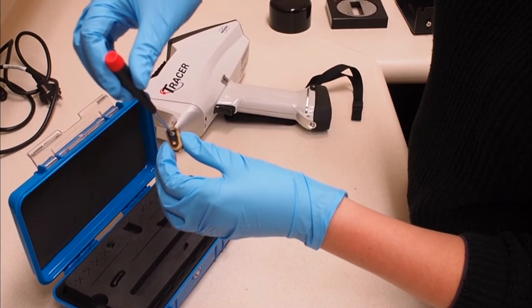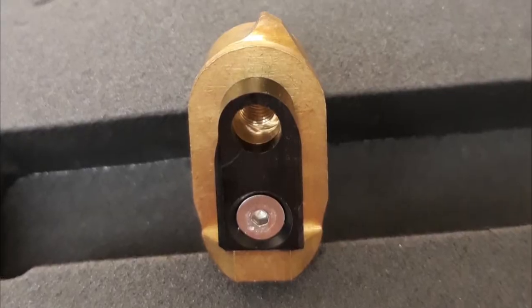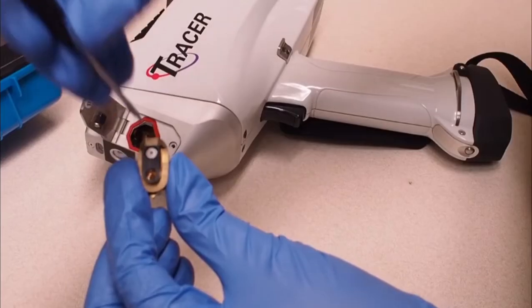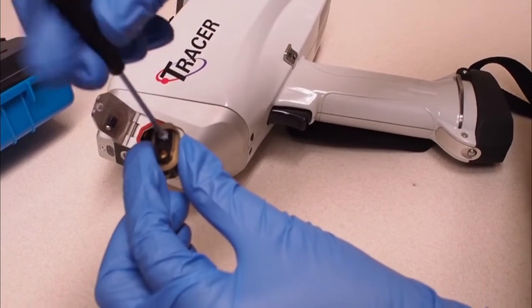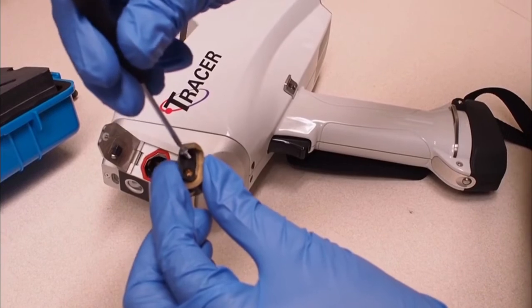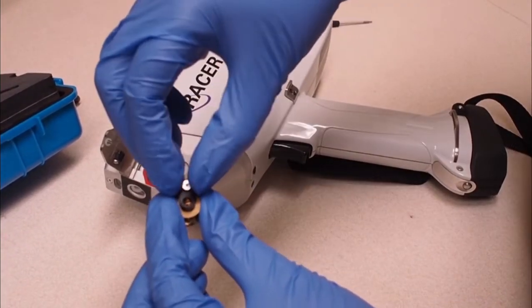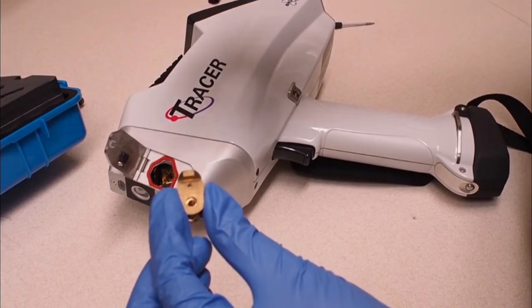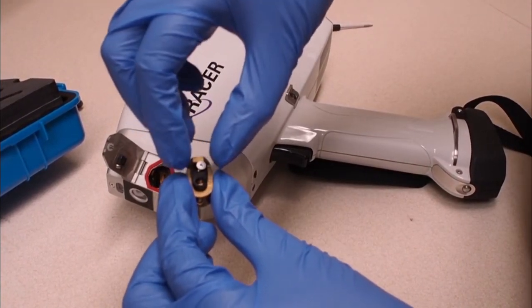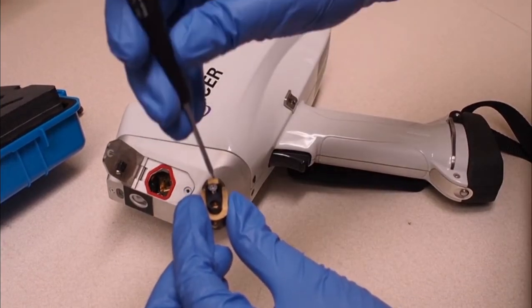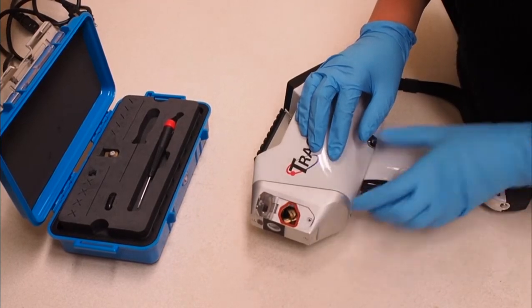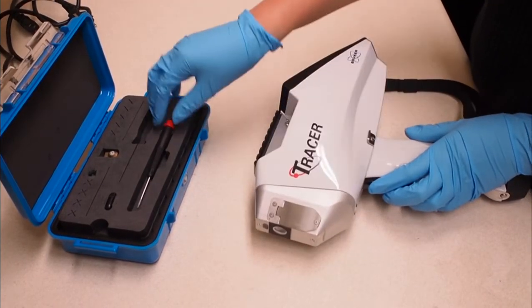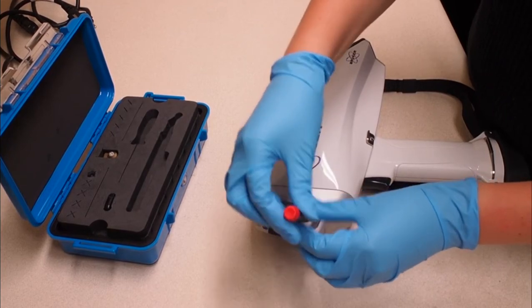The filters are also manually changeable and are attached to the back of the relevant collimator. If the filter needs changing, use the same screwdriver to remove the current filter and replace it with one in the accessories box. The filters can only be inserted one way as shown. Screw the new filter in place. Take care not to touch the film in the filters. Once you have the correct collimator filter combination, carefully insert it into the instrument along the correct edge and gently push it in. Replace the screws on the cover.